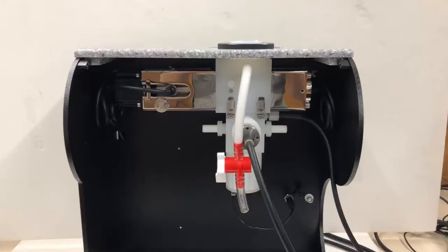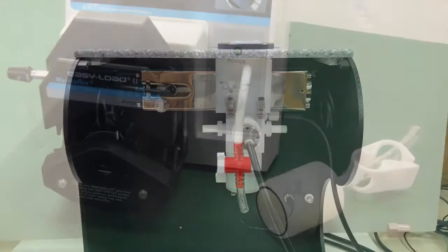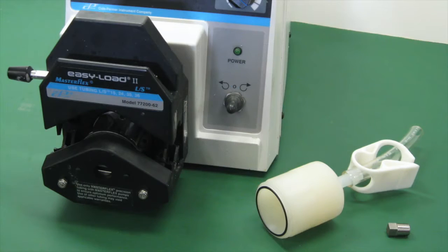This chassis holds the acoustic sensor, which can be equipped with different sample chamber setups depending on the goals of the user. The standard sample chamber allows for measurements with all probes, as well as mixing with the magnetic mixer attached to the bottom. This mixer can be replaced with a pump adapter, which allows for mixing to be performed instead by an external peristaltic pump.